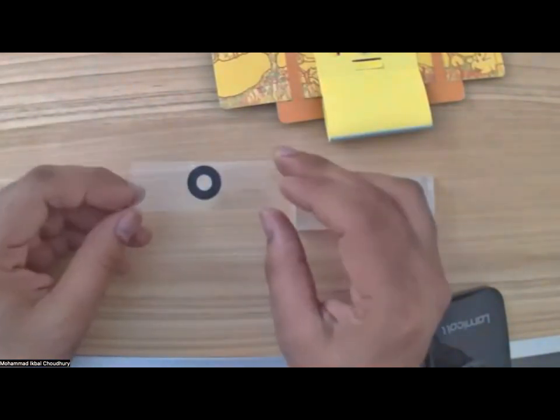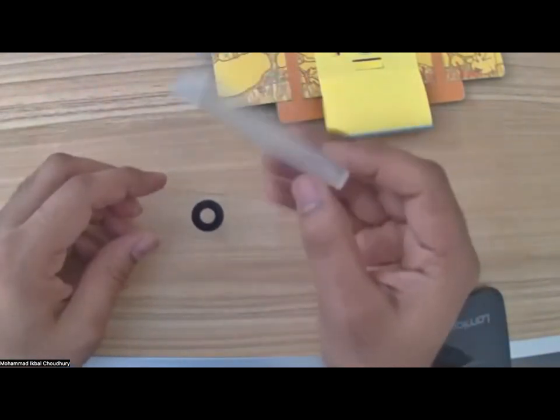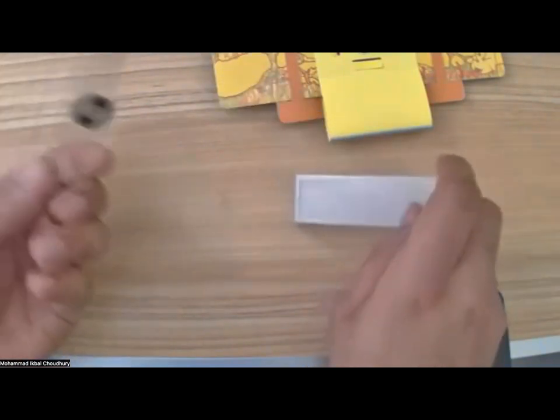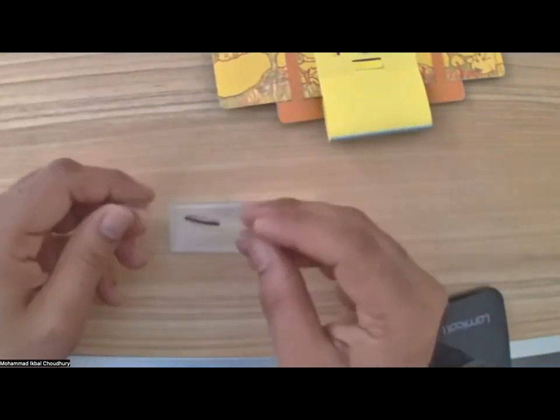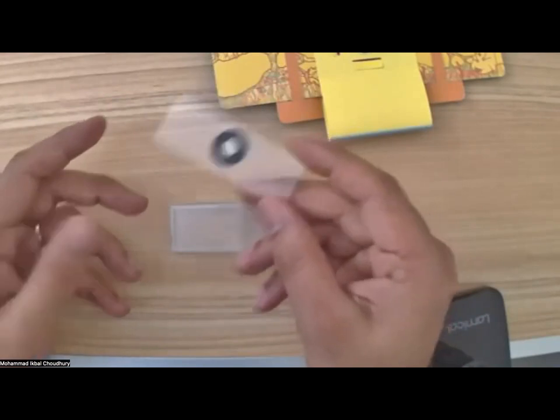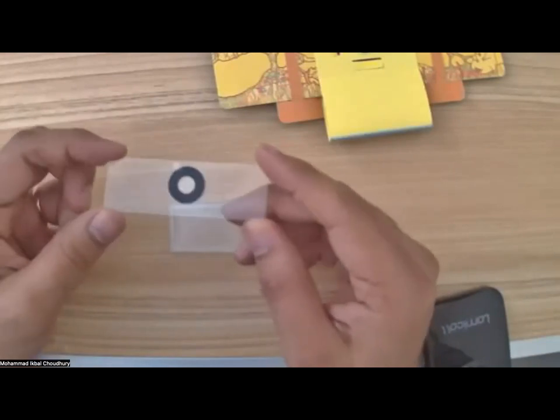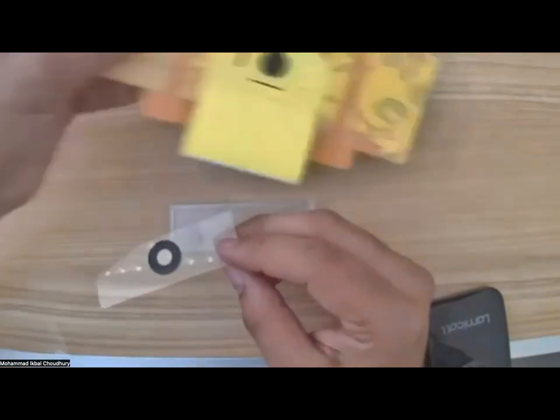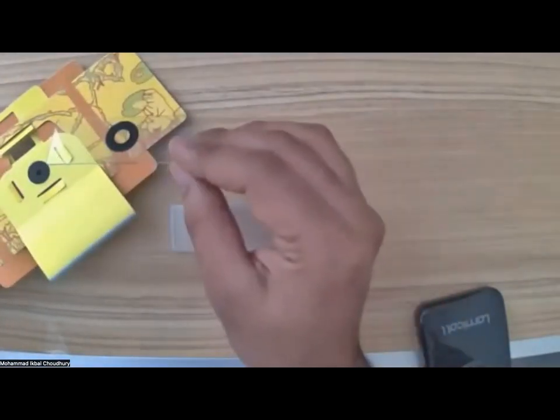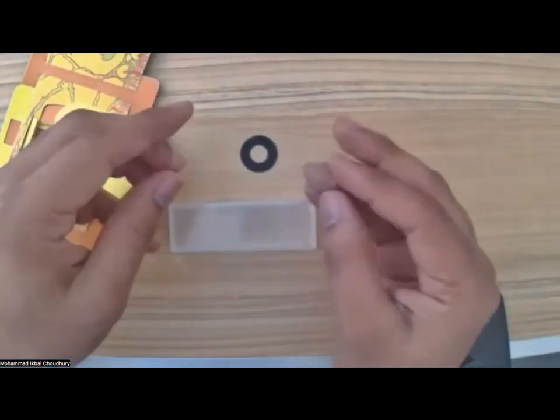So you all must have received a spare slide or two in that kit. You probably found it in this box. Okay, that was not pre-made. It was just a regular microscope slide. This thing has never changed in the last, I think, 50 or 100 years. It has remained the same exact microscope slide. And anywhere you go, whether they're doing blood smear staining or anything, they use the same kind of slide, right? So what the foldscope guys did is they made the microscope around the slide so that you don't have to change the slide. You can use any standard quality slide. So even if you wanted, you could buy more slides.